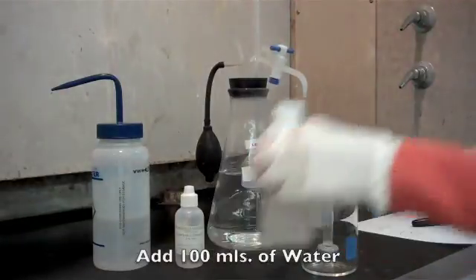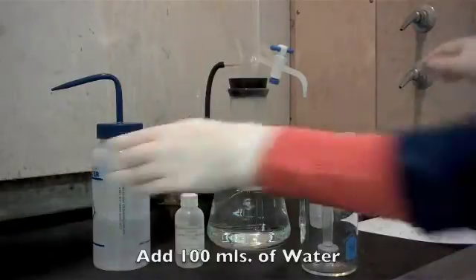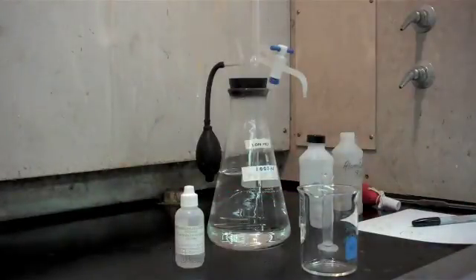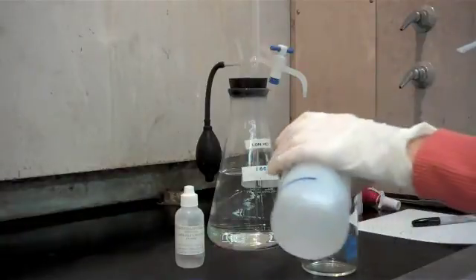Next we're going to add approximately 100 mils of water. It's not critical that you get an exact amount, but we just want some dilution in there so we can see our color change.